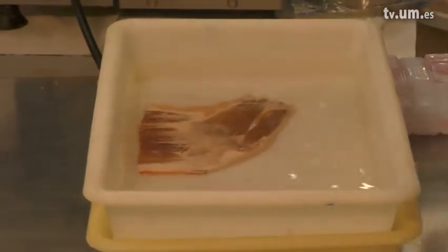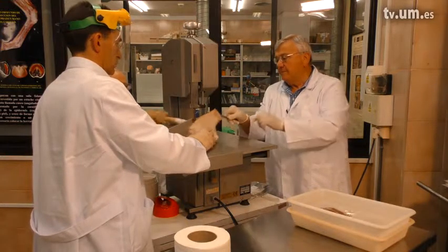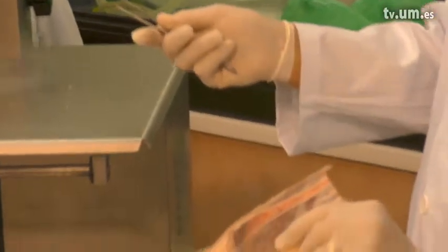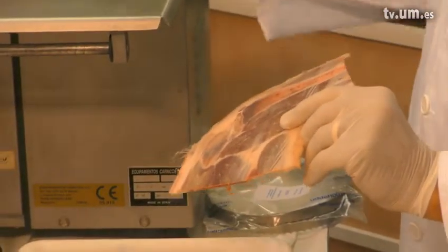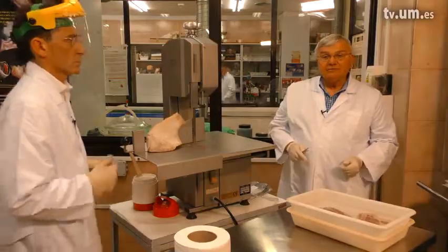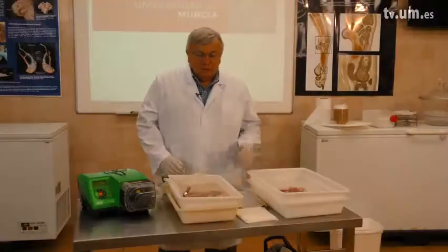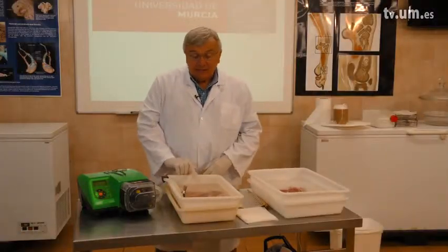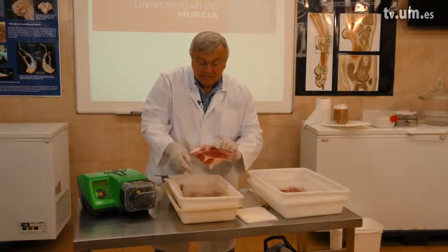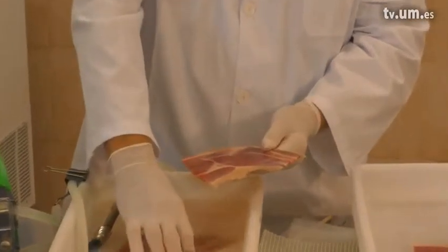This is cold acetone. The slice tends to want to stick to the major piece because it's so cold. Again, we'll put it in cold acetone and then clean the sawdust off. We have cut the slices now, and we need to clean them to get the sawdust off. We can see there's sawdust here, and we have two or three methods to remove it.